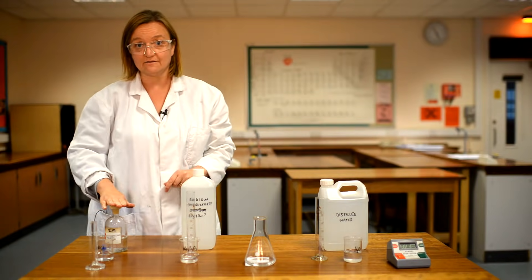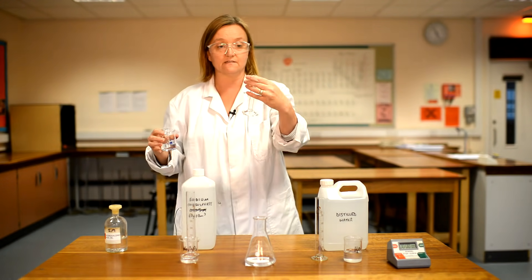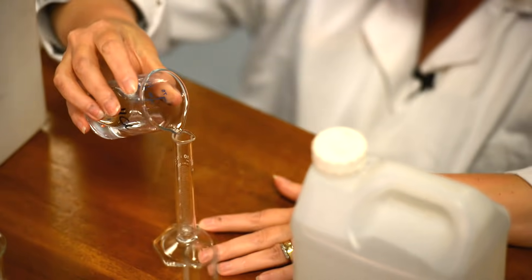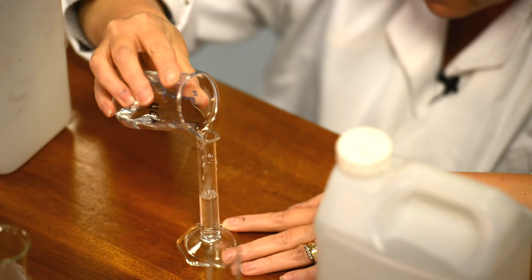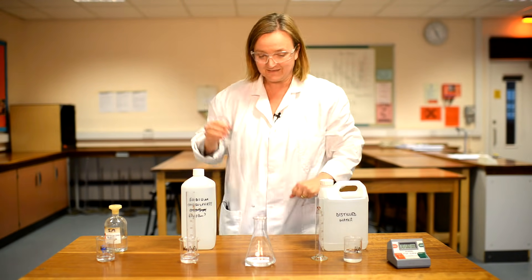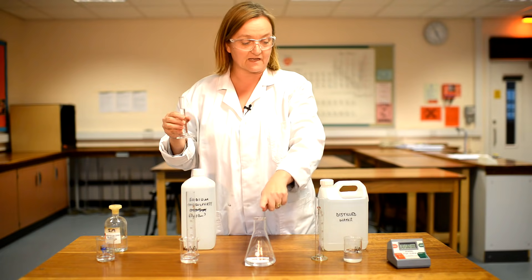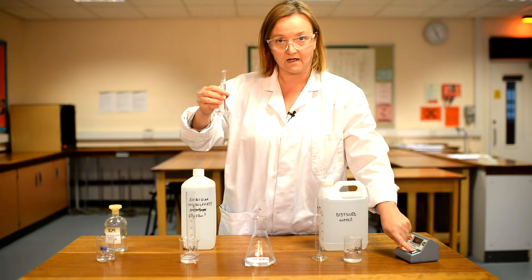I'm now going to measure out just 10 centimetres cubed of the acid using a slightly smaller measuring cylinder, getting down to eye level, holding it firmly so it doesn't fall over, and measuring out exactly 10 centimetres cubed. You can use a dropping pipette to do that. The reaction will start as soon as I mix the acid with the sodium thiosulfate, so I need to be ready with my timer.